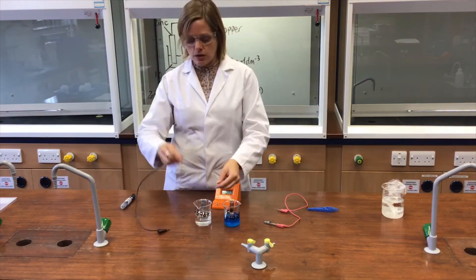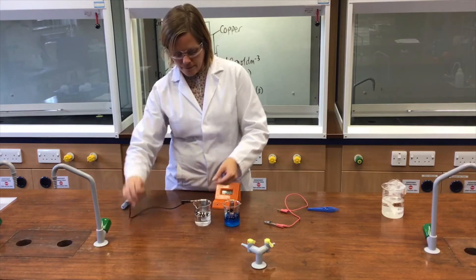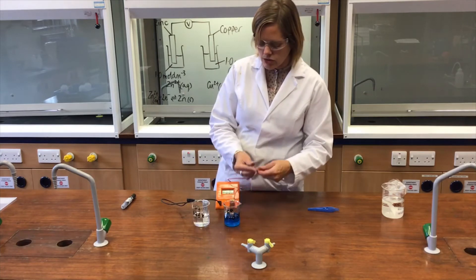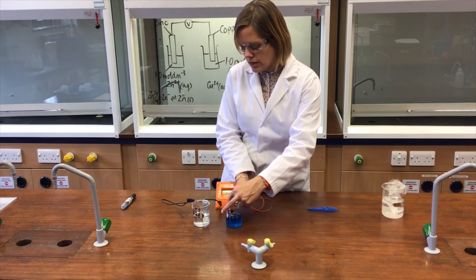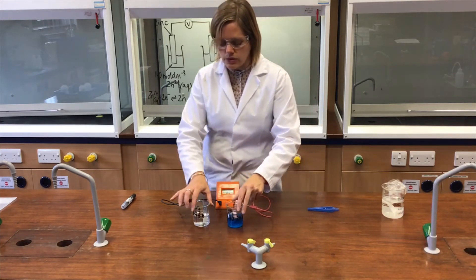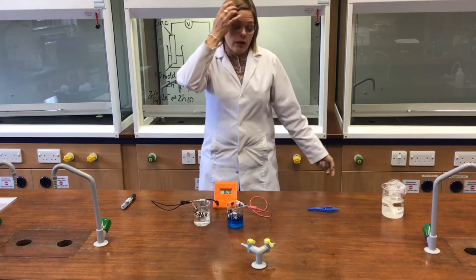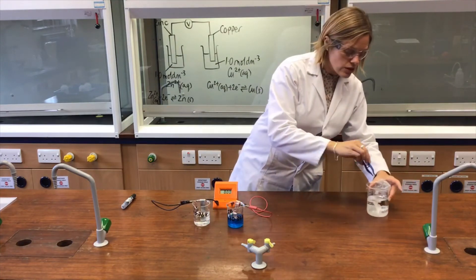To attach the voltmeter, I take a crocodile clip, attach it to the zinc electrode, and connect it to the voltmeter. I do the same on the other side, attaching a crocodile clip to the strip of copper, which acts as both electrode and reactant. We still don't have a complete circuit though — we need a salt bridge.